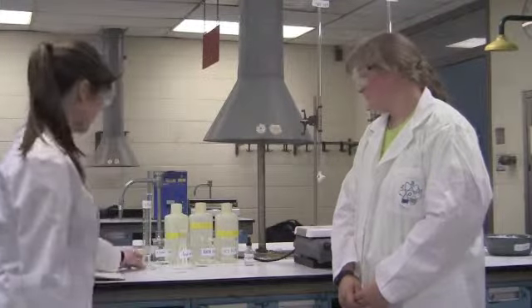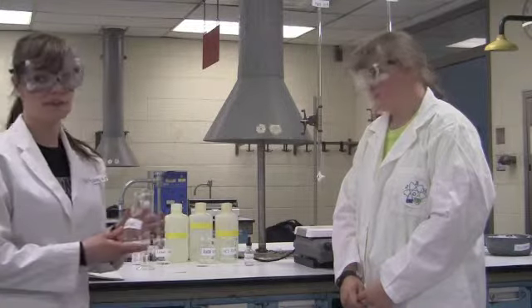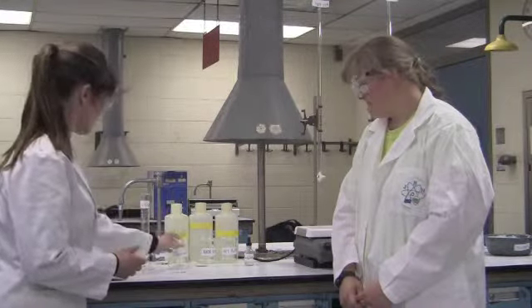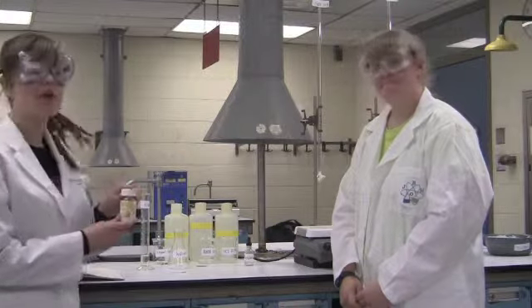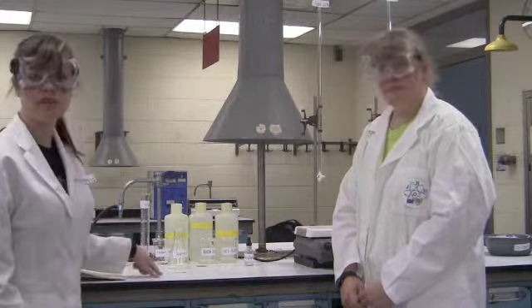Okay, to begin, we gathered all our supplies. We have our ethanol, which is 100% concentrated. We have our Erlenmeyer flask for our analyte. We have our aspirin, and we already weighed out a sample, mass of 0.3405 grams.